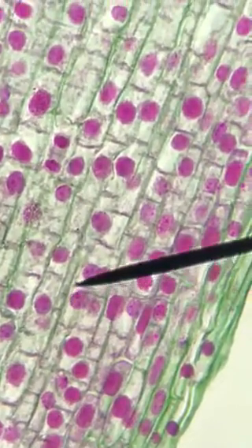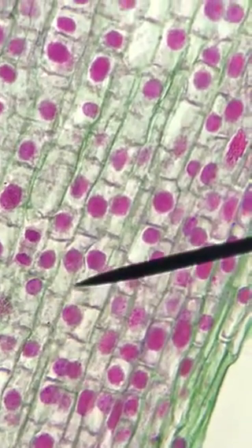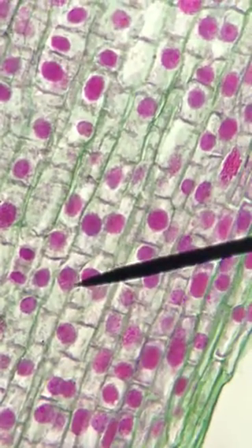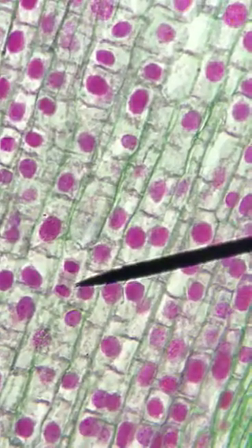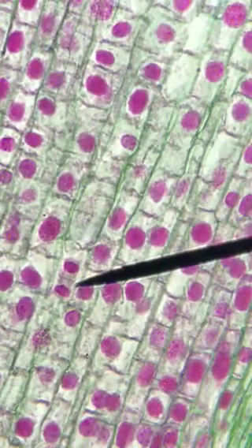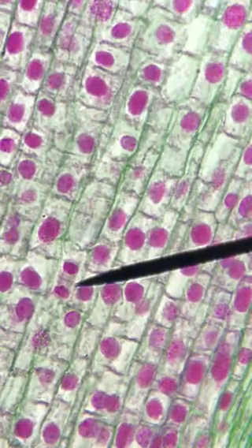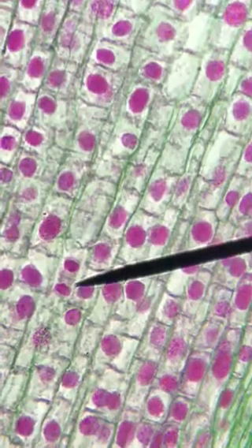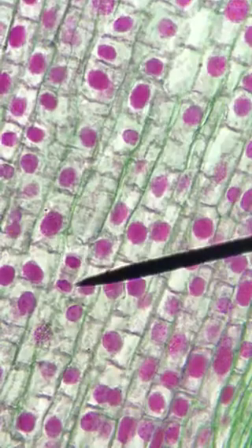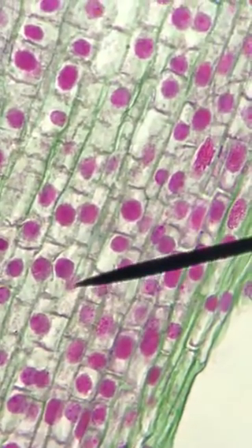Keep moving along. These are mostly prophase. I'm going to move over here because I'm seeing something that we didn't see yet. This here is a great example of telophase. You can see the cell plate starting to form between the two newly formed nuclei. That's a great example. Cytokinesis would follow. So I'm just going to jump back over to where I was. There we go. Continue moving.